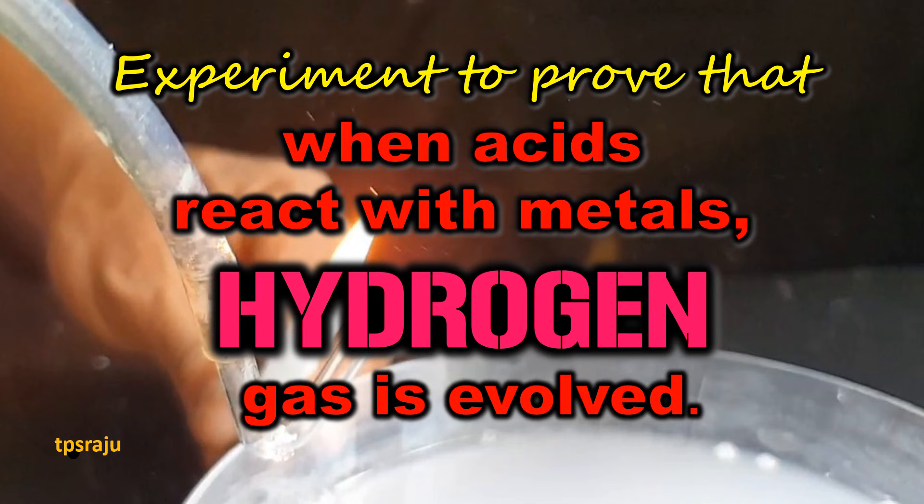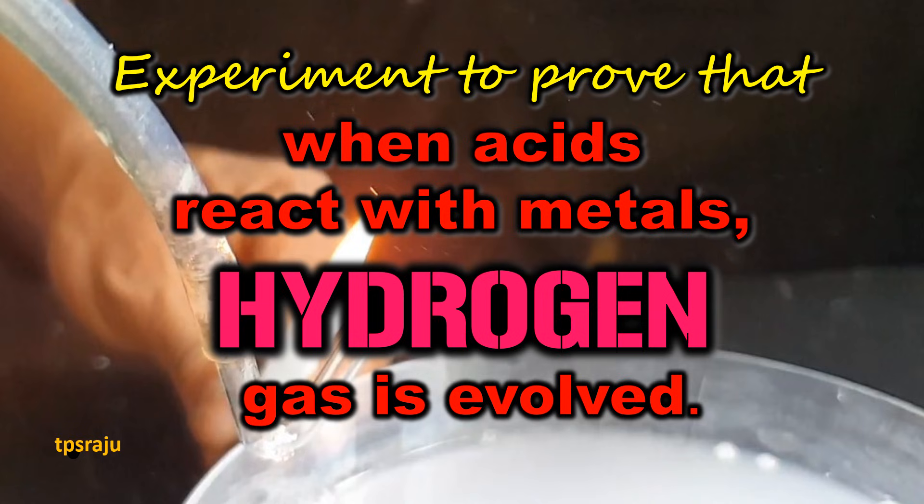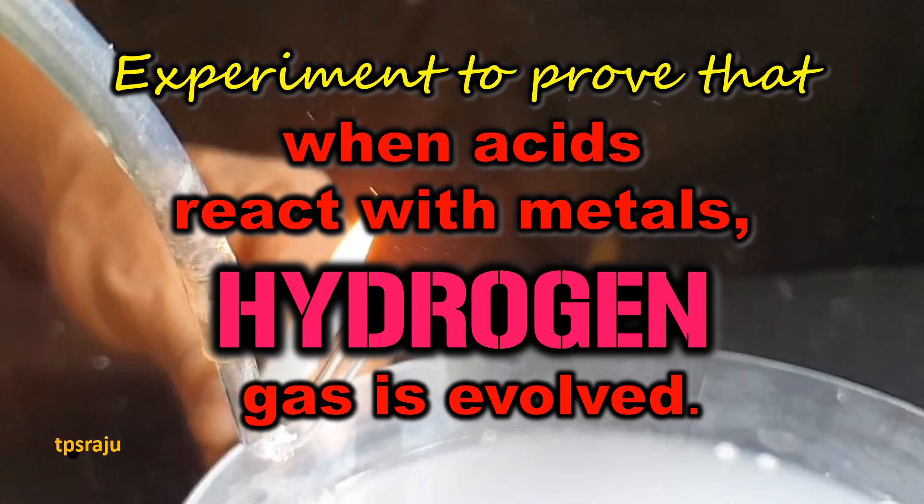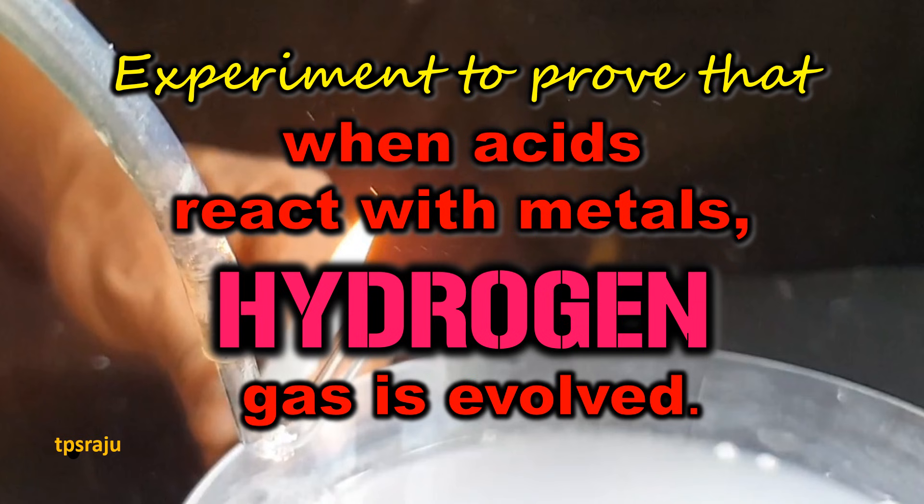Hi, good morning. Today we are going to learn about an experiment to prove that when acids react with metals, hydrogen gas is evolved.